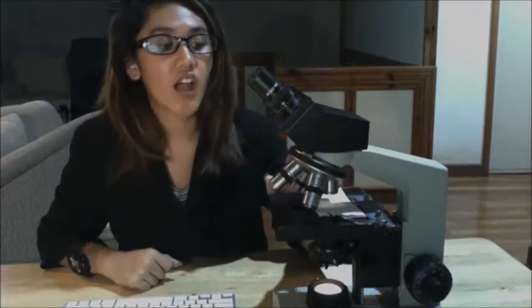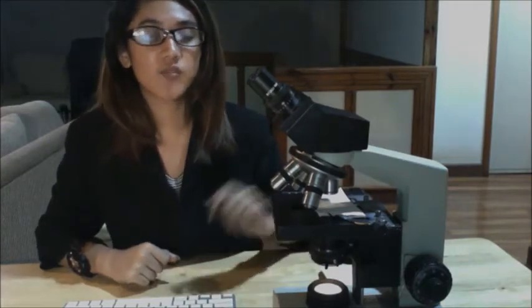And then you have the most modern microscopes, wherein these modern microscopes are parfocal. This means that once the specimen is in focus with one objective lens, only a slight turn of the fine focus knob is required when changing to a higher objective. So you should only use the fine focusing knob after adjusting the coarse adjusting knob in one of your objectives.